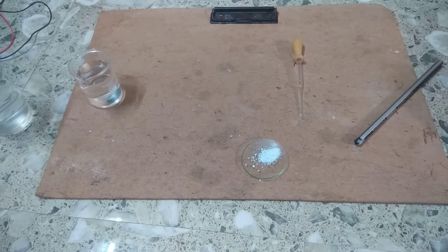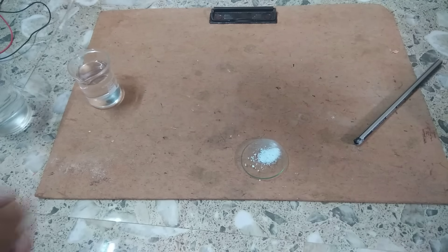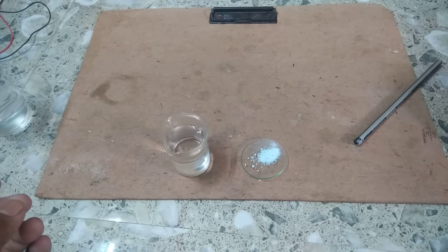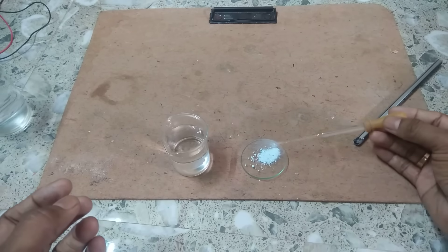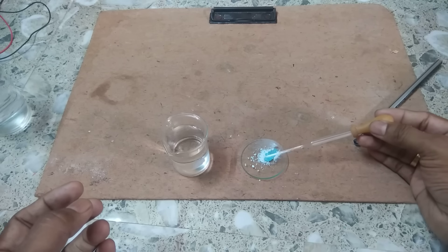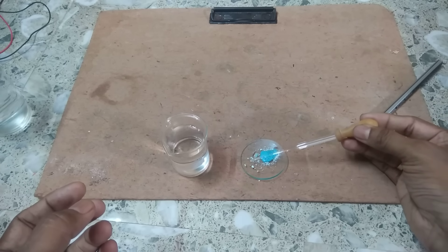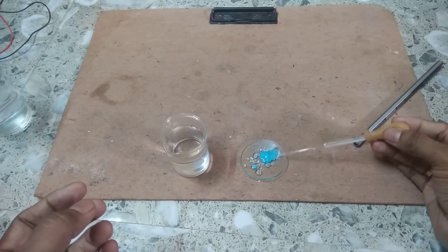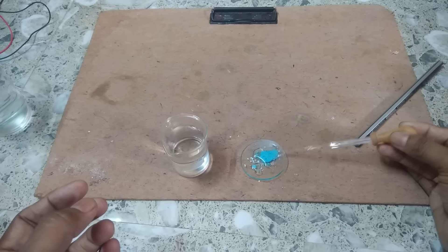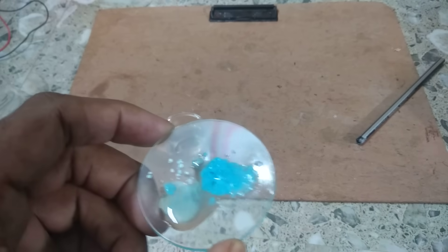Let us take water and put it in. We have taken water and put it into the white copper sulphate. Let us see what happens. You see, this changes again into blue color. That means it is a reversible change.